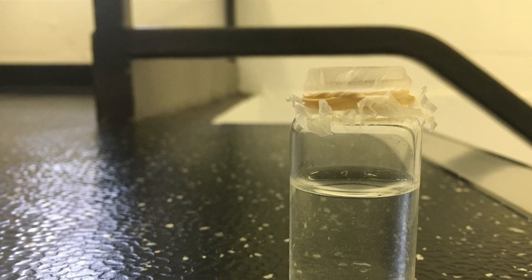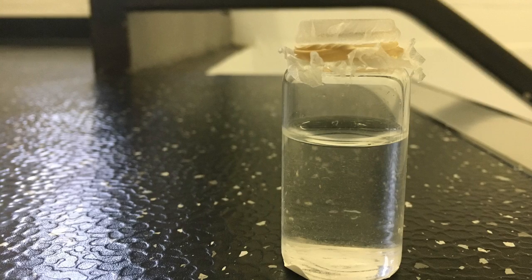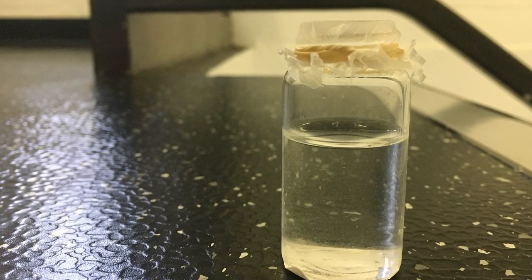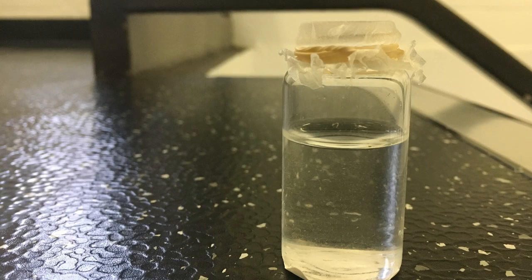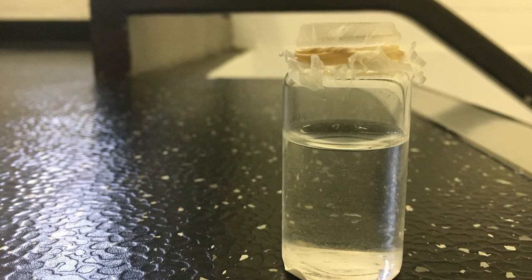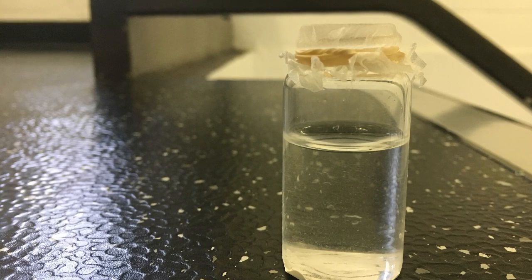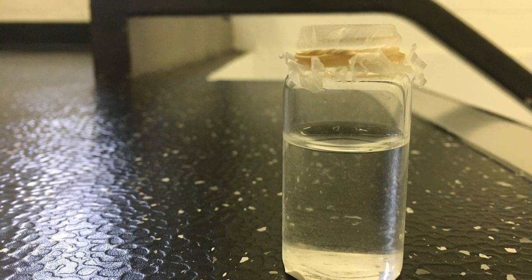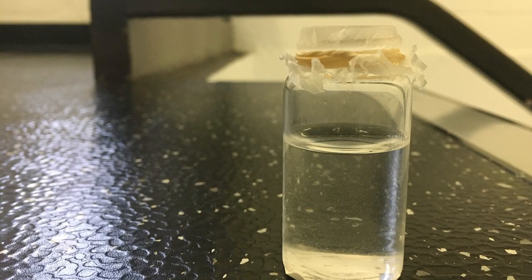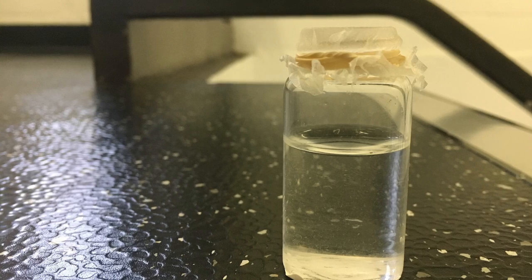Rinse the alum directly in the Buchner funnel with 5 milliliters of 50-50 ethanol water mixture. Gently stir the contents with a glass stirring rod and proceed to turn the vacuum back on to remove the rinse. This process should be repeated 2 more times in order to ensure that the alum has been entirely cleaned. After the third completion, continue to pull a vacuum on the solid until it is completely dry.